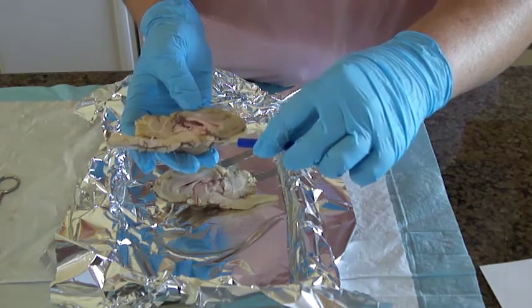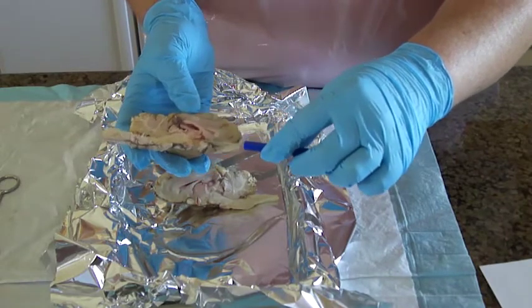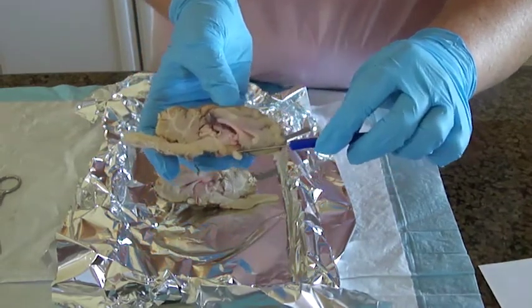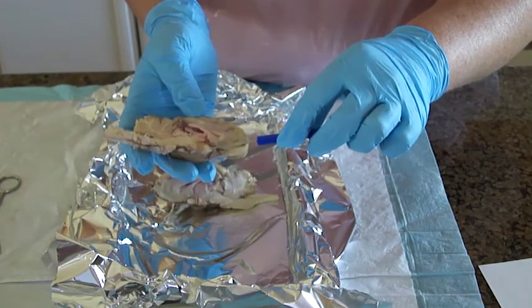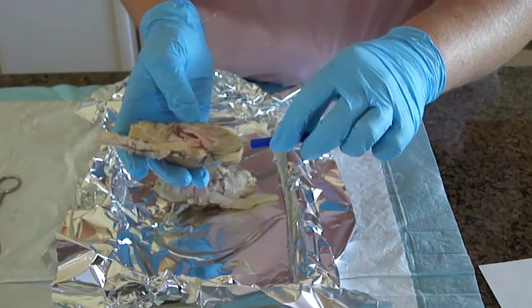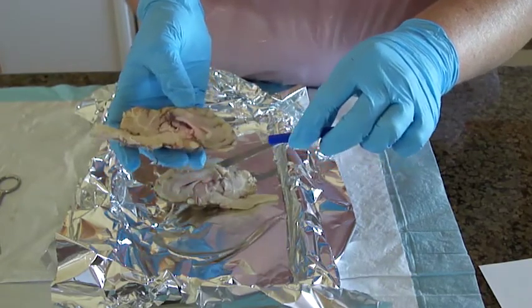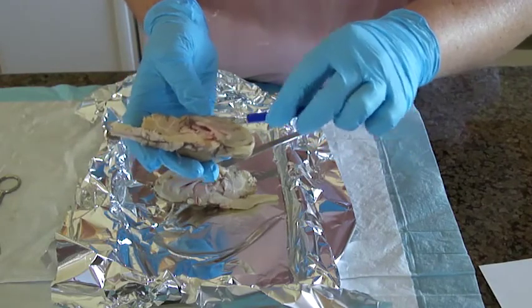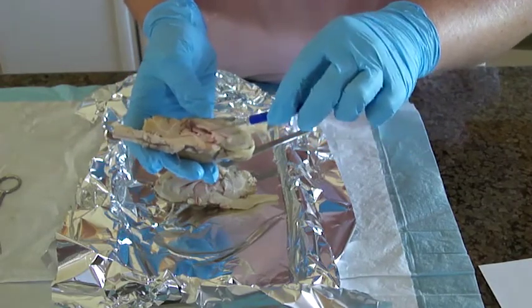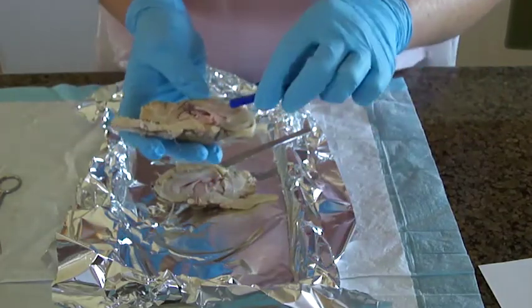The hypothalamus is this little tiny thing right here, and the optic chiasm is in front of it. The olfactory bulb is up here, or down here. The corpus callosum, again, is up here. The lateral ventricle, we also do this in ultrasound, we always measure the size of the lateral ventricle.